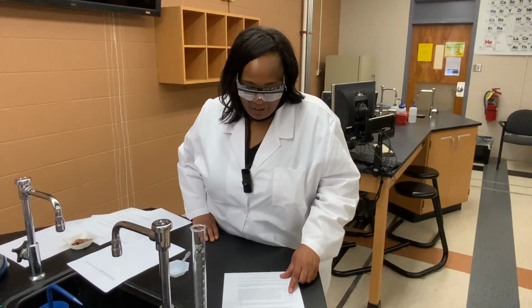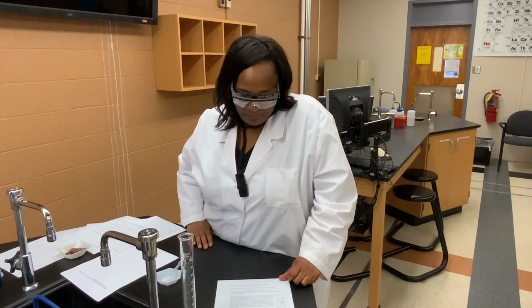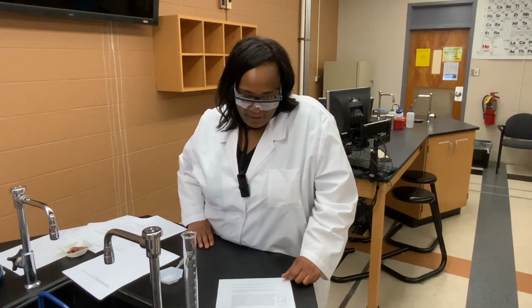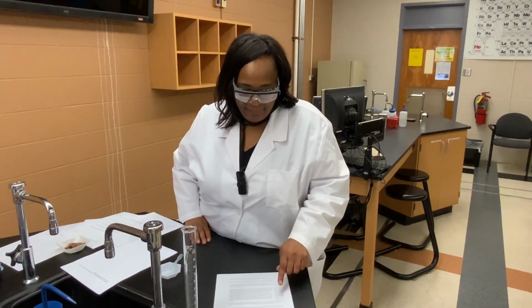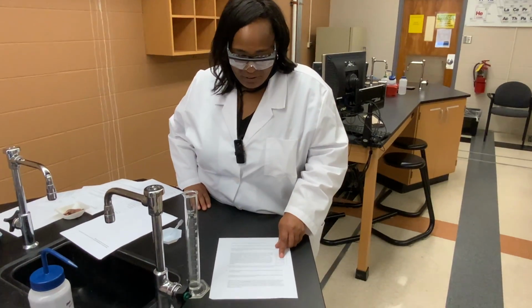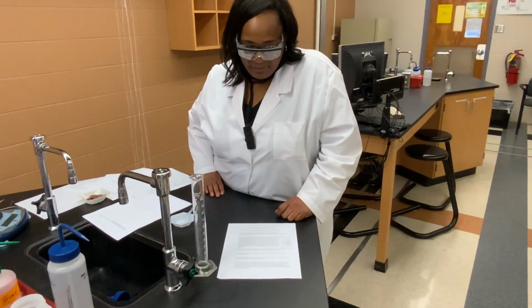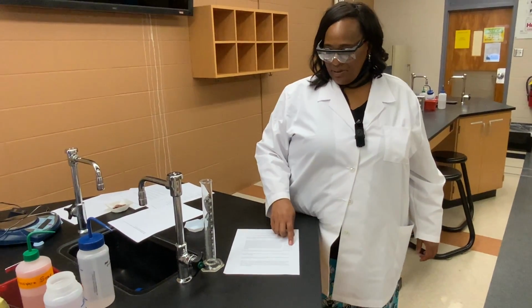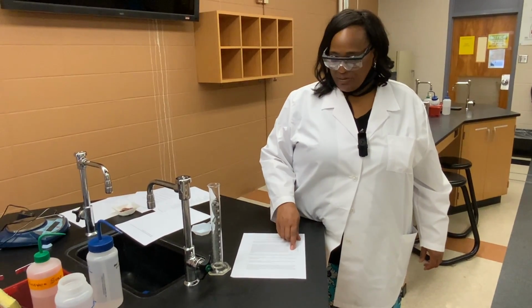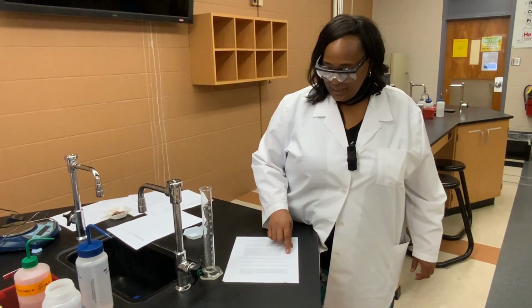And so if we take a look at the picture here for question L, what would be the recorded value for the volume of the liquid in this graduated cylinder here in this picture? Make sure you examine it carefully. Check the answers with your group members. Make sure you all agree on what the volume is represented in this picture. And always read the bottom of the meniscus or the curve.